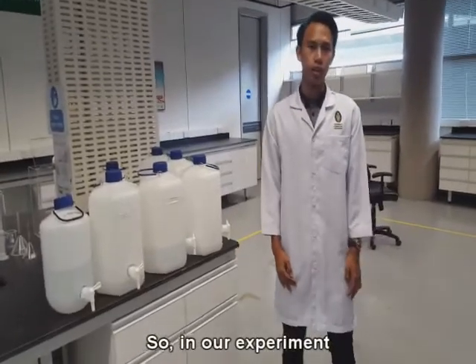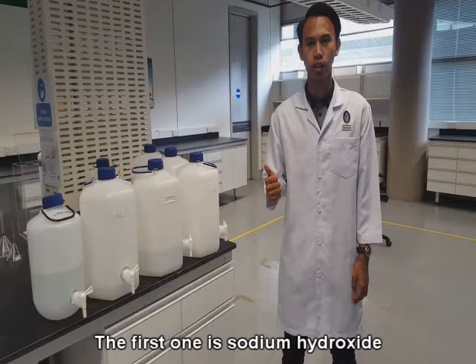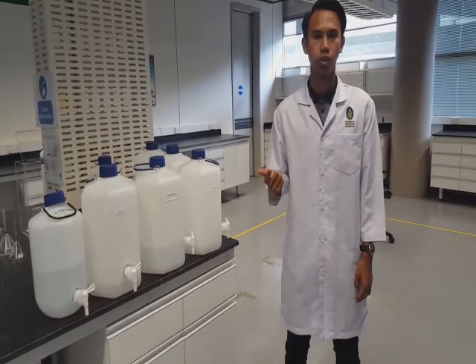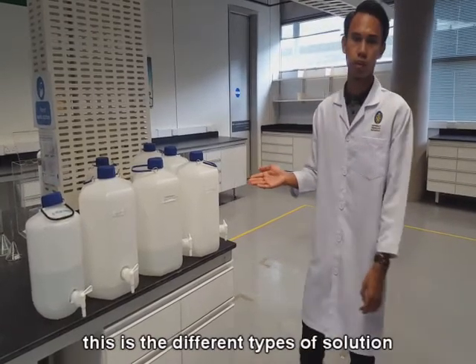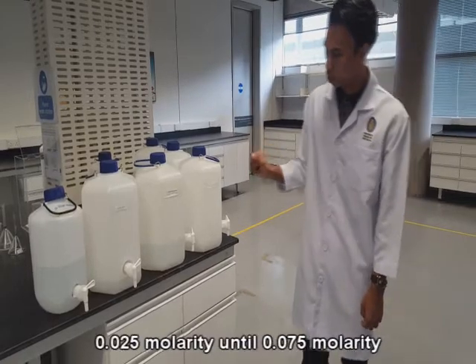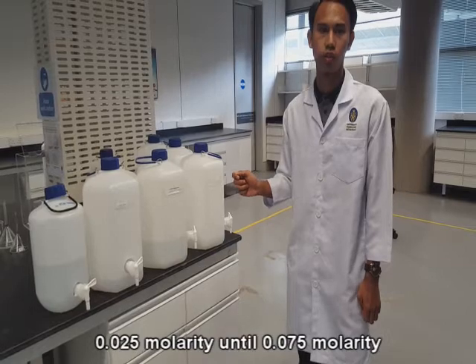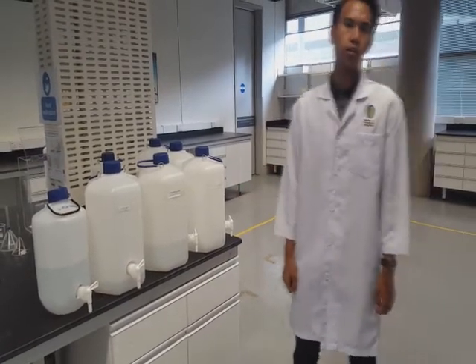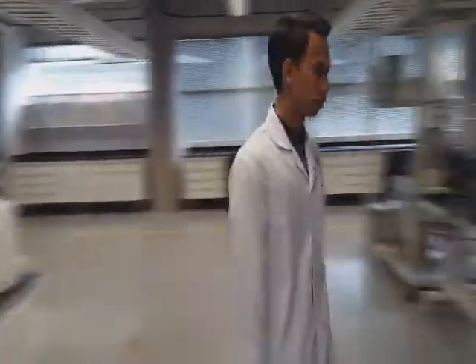So, in our experiment, we use 2 different types of solution. The first one is sodium hydroxide and second is ethyl acetate solution. So, as you can see here, these are the different types of solution, ranging from 0.025 molarity until 0.075 molarity for each solution. So, next, let's move on to the apparatus setup.